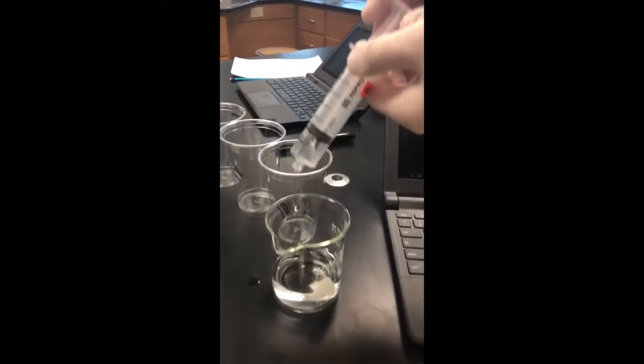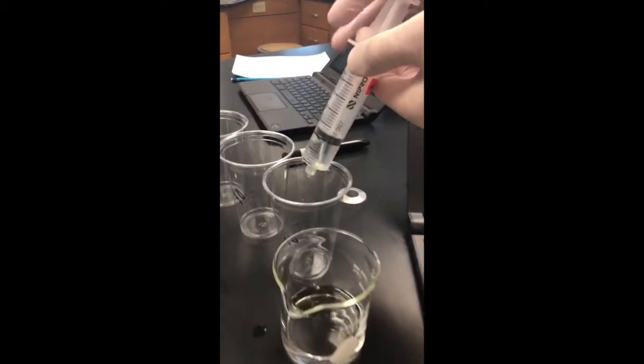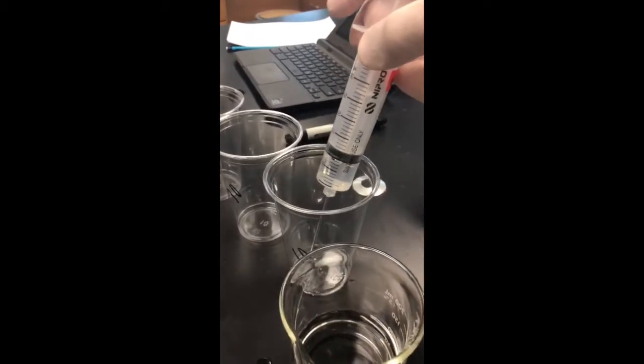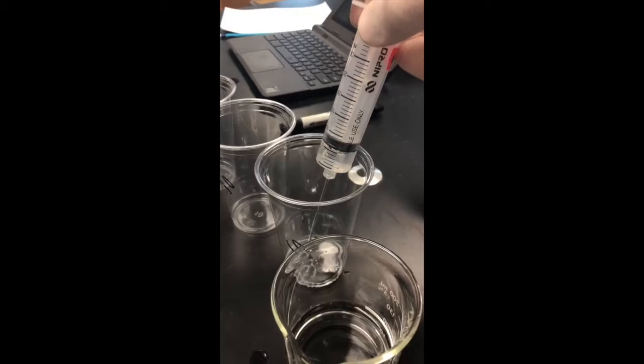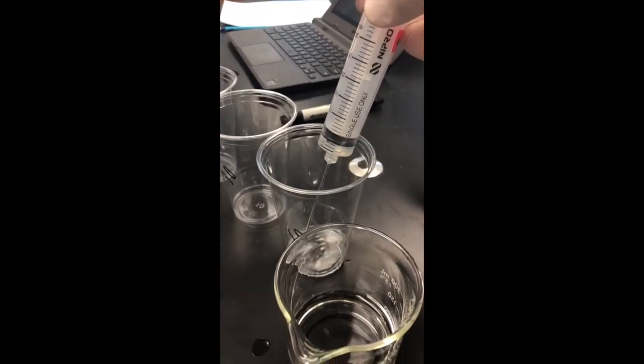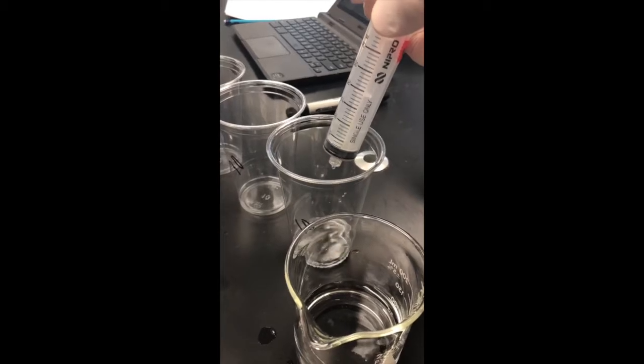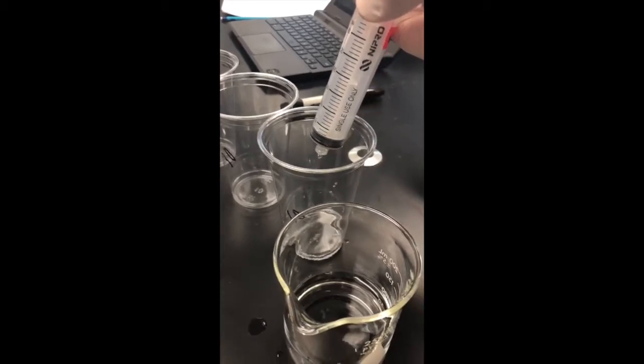Our hypothesis for this experiment is, if the enzyme catalase functions to speed up the process of breaking down H2O2 into oxygen and water, and we add catalase into several cups containing H2O2 for various time intervals, then the longer that the catalase is allowed to react with the H2O2, more H2O2 will be decomposed.